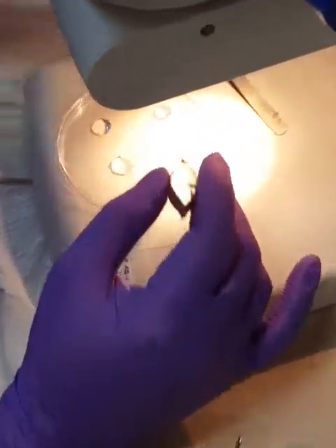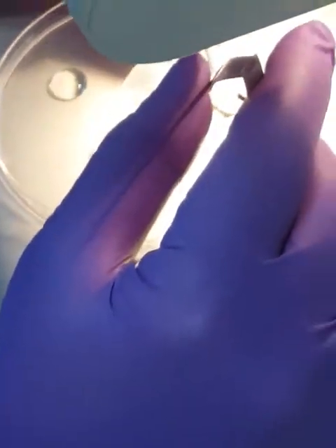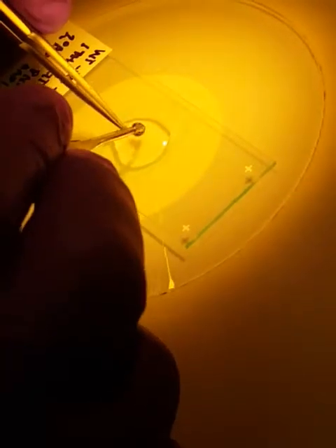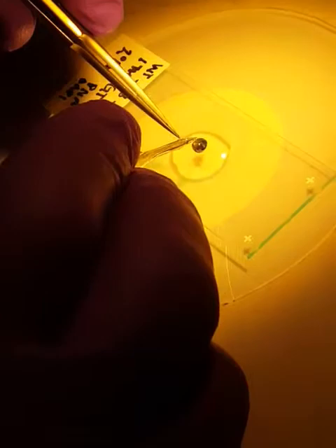I'm going to move them out, over to the top of that edge. The idea is this needs to be facing down, and from here we will start to peel each of these quarters.